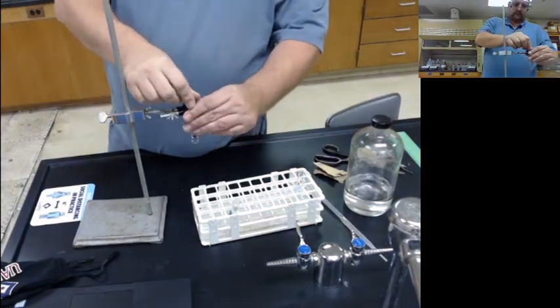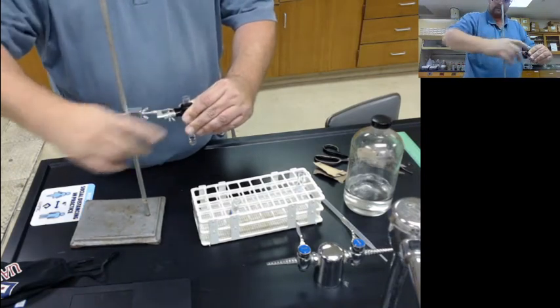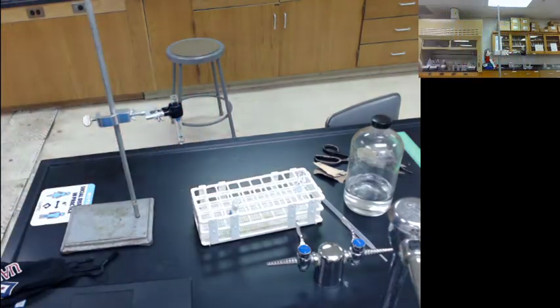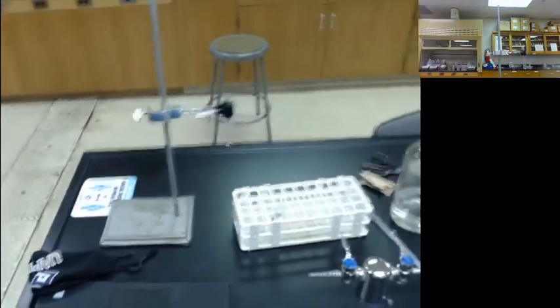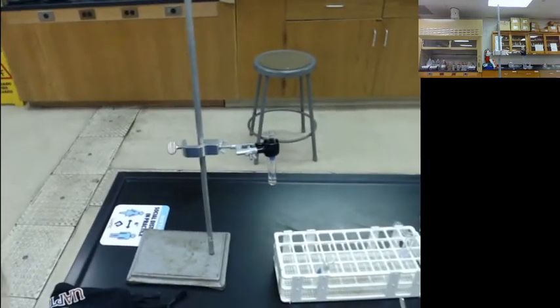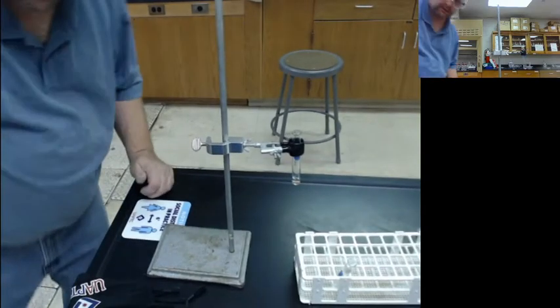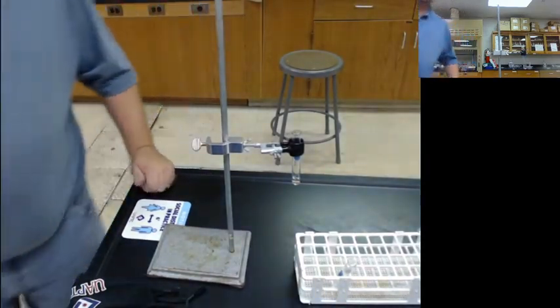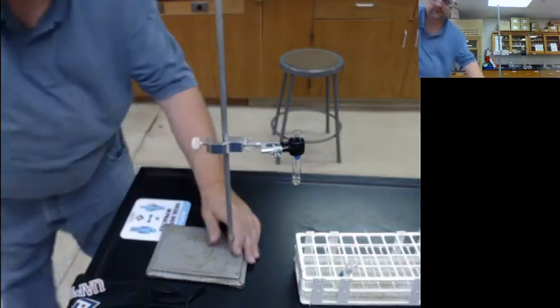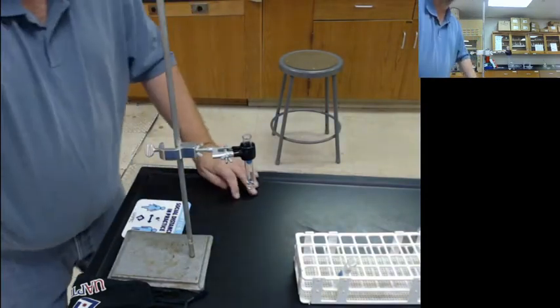This is one of those instantaneous reactions. And let's see if I can get this maybe just a little bit closer. Close enough.